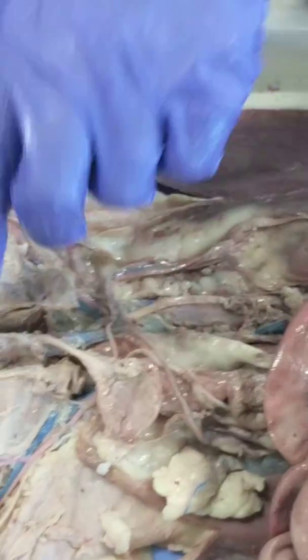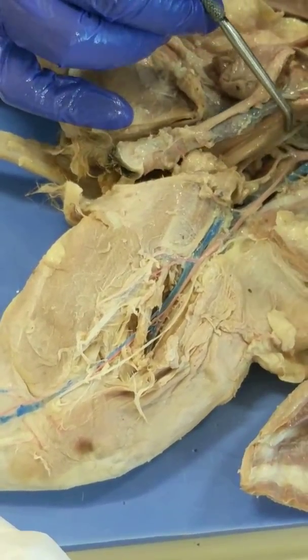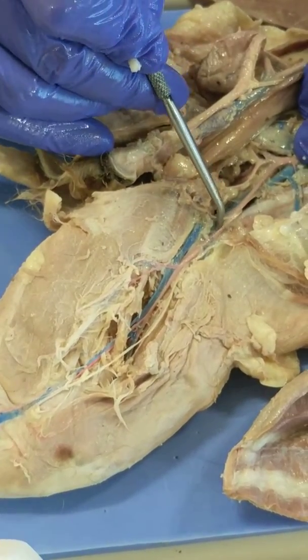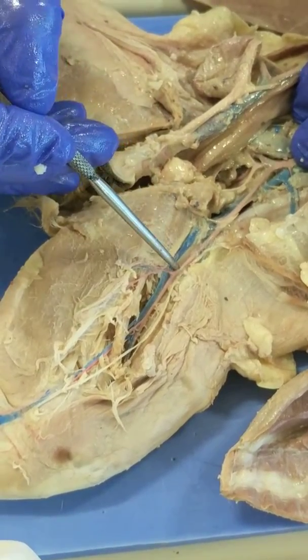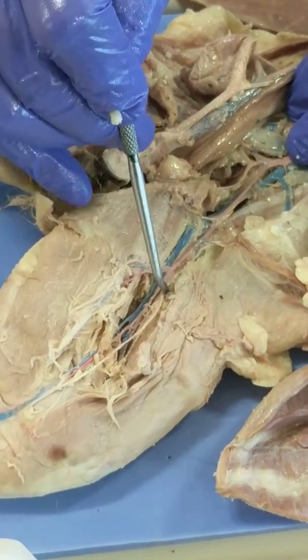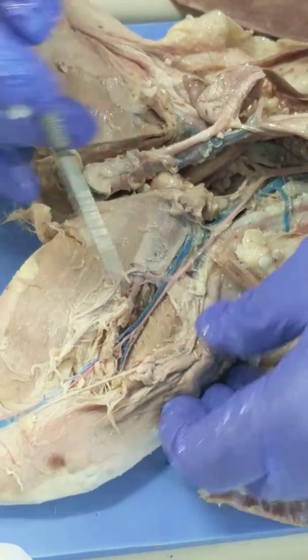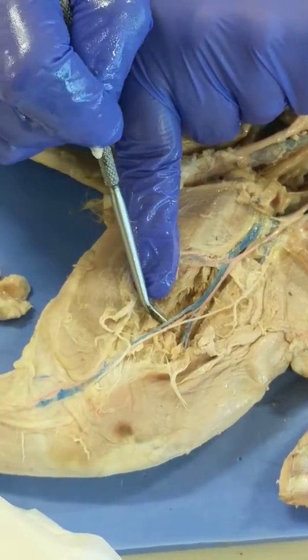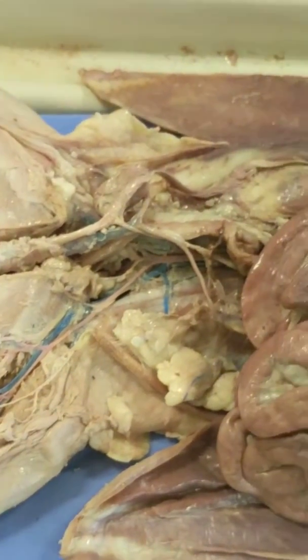The only other thing we didn't mention in the first video is that the external iliac arteries continue out of the body cavity and give off the femoral artery. So in the leg, the branch of the external iliac is really called the femoral artery. And this vein is called the saphenous vein — we neglected to mention that. And that's everything.